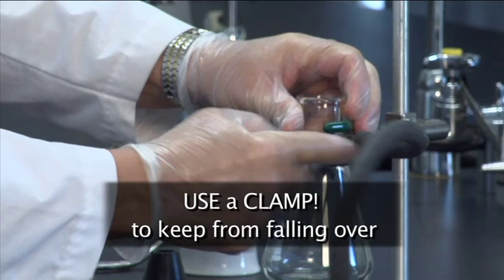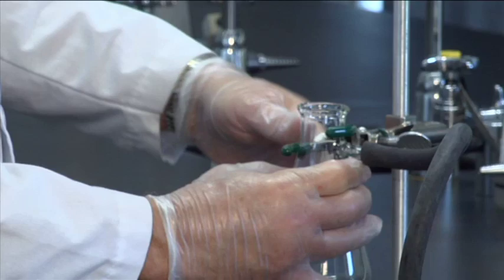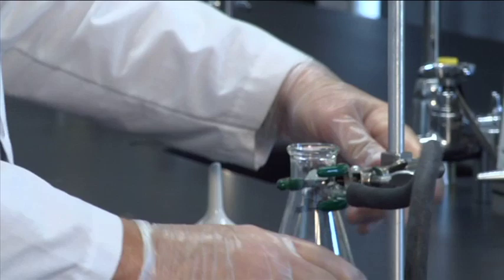So we're going to clamp this thing so it doesn't fall over. Put that hose through the two arms. Turn that tight. All right. Now it's going nowhere.